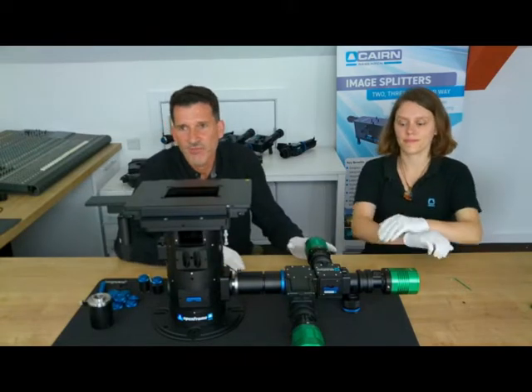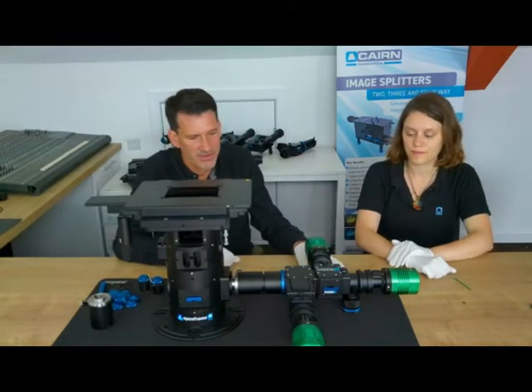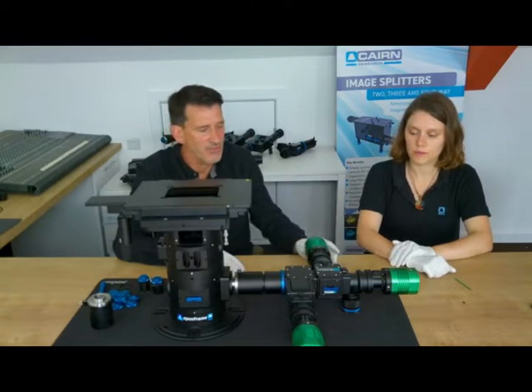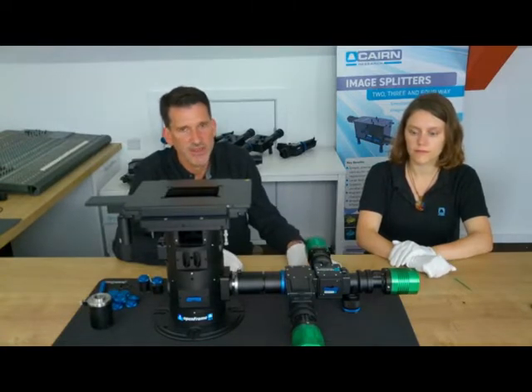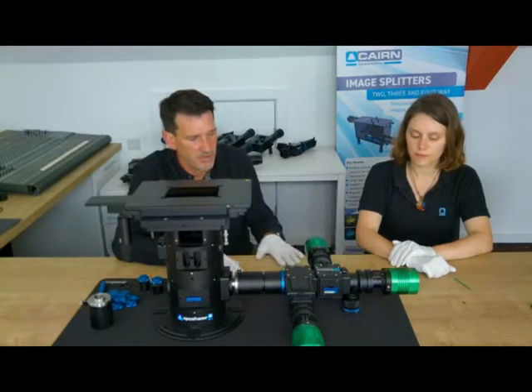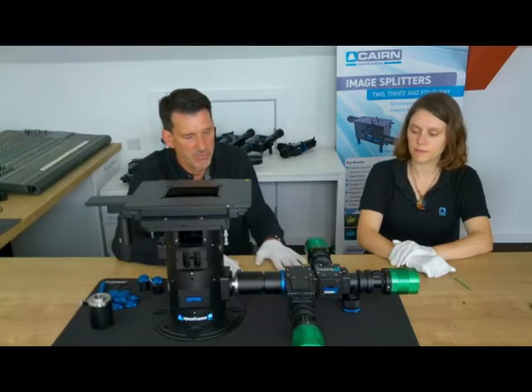So as cameras have become cheaper and CMOS technology has taken over and moved down the price point, there's circumstances whereby you can get away with a somewhat less expensive camera, and you can achieve the multi-channel high-speed solution by multiplexing the number of cameras rather than splitting the chip up of a given sensor.